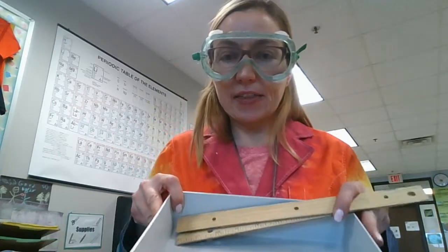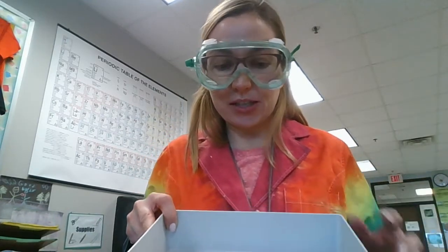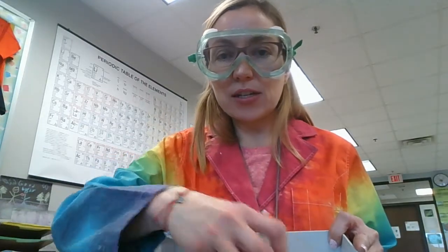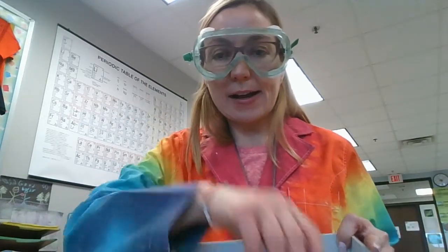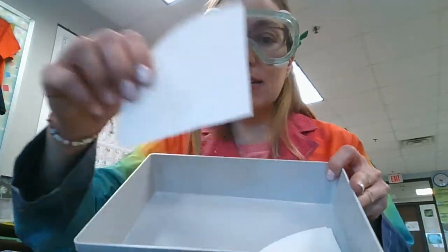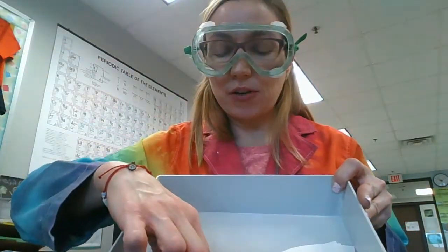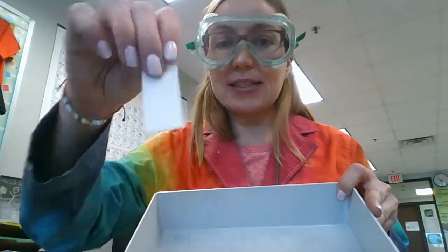Now I need to get my TLC plate and the rest of my materials ready for TLC. At your lab station you're going to find a tray with some rulers that you'll need and some matches we just used. Then you're going to find these little triangles of filter paper and you're going to find your TLC plates.